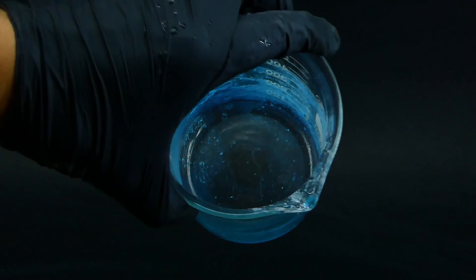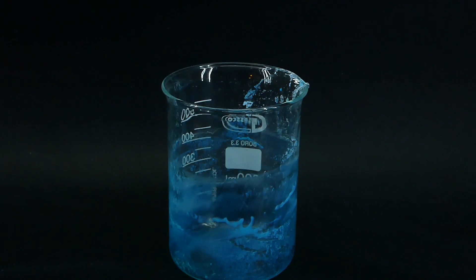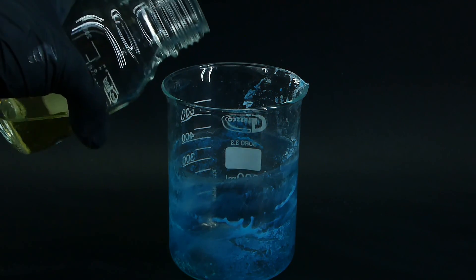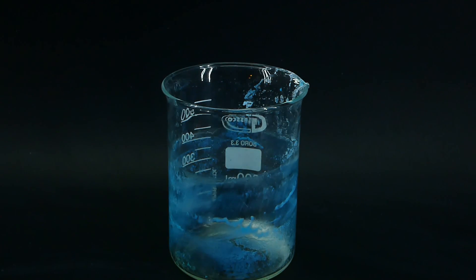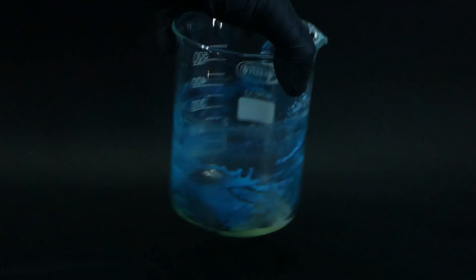Also, basic copper carbonate leaves stains on everything since it's insoluble in water, and the only way to remove them is to use some kind of an acid. I used some dilute hydrochloric.